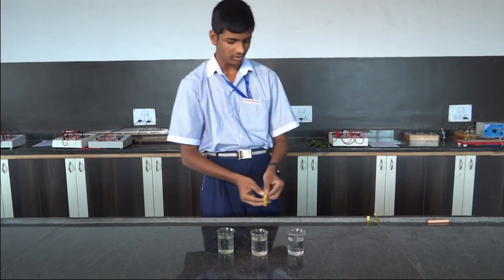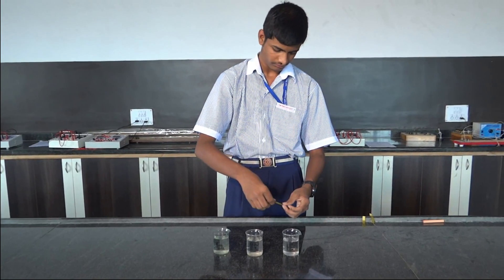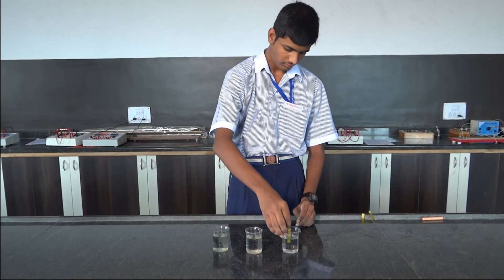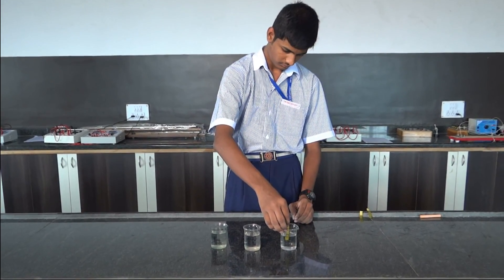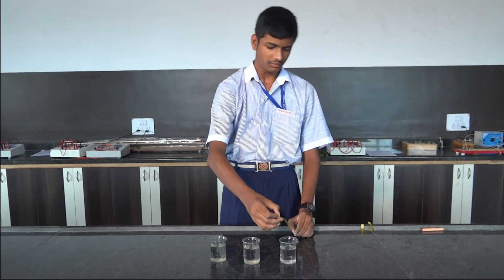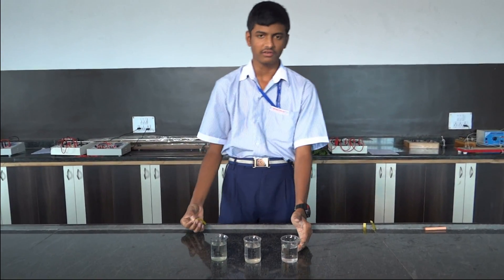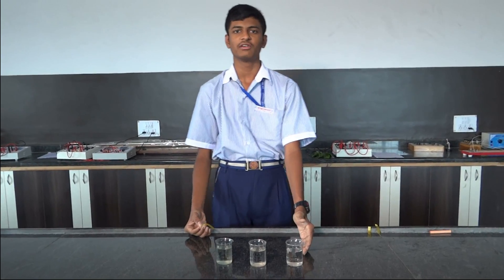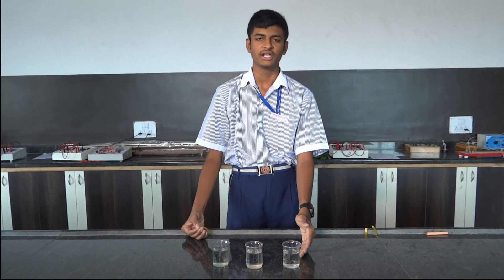Then we will go through well water. The pH value of well water is 7.5. It is more than 7, and since it is more than 7, it is alkaline.